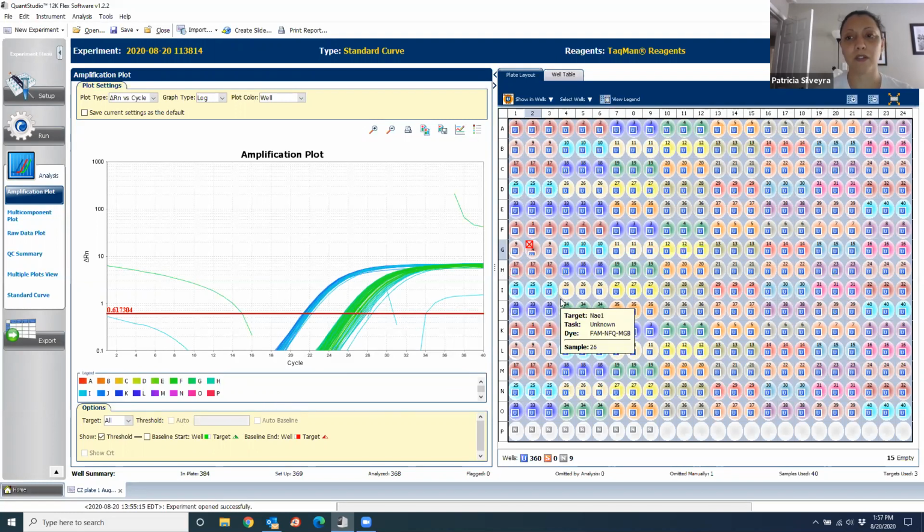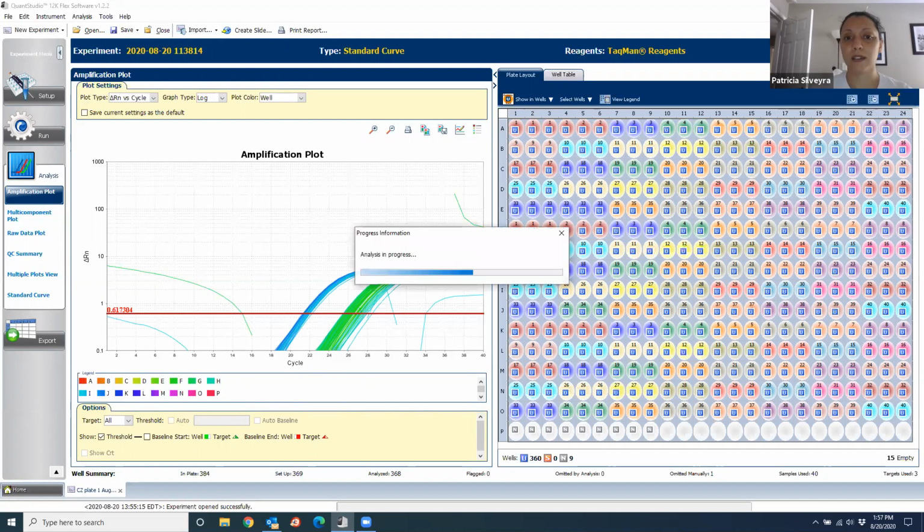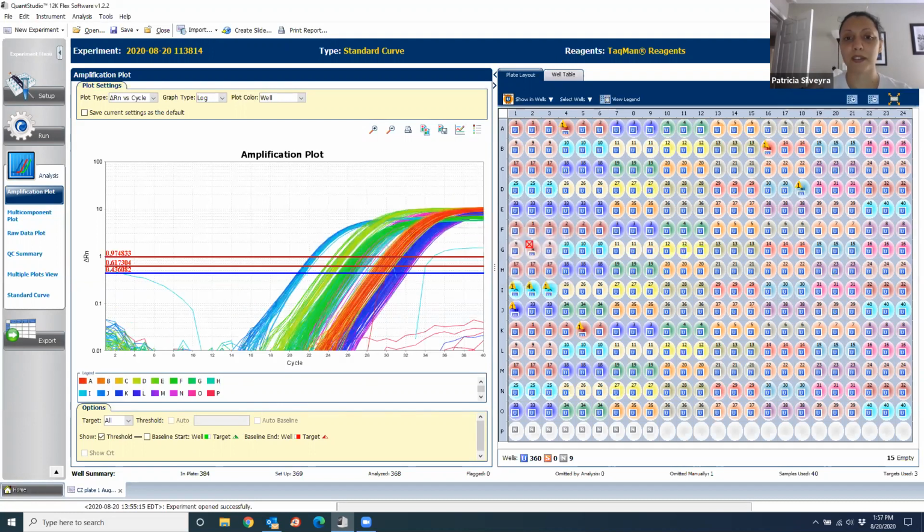So every time that you omit a well, you have to reanalyze the plate. And to do that, you have to click here on Analyze, and it will just take a little bit. And now, see, the plot changed because we removed the high background looking well. So now we're going to go to the rest of the wells that show problems and see what kind of problem there is and whether we should remove that sample or not.